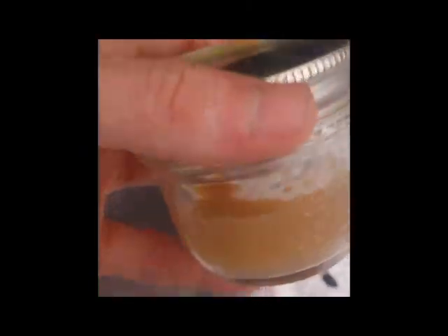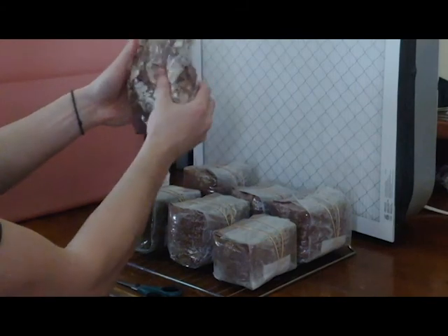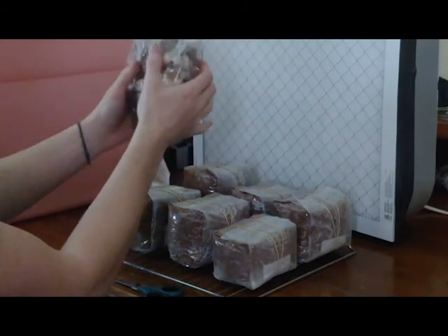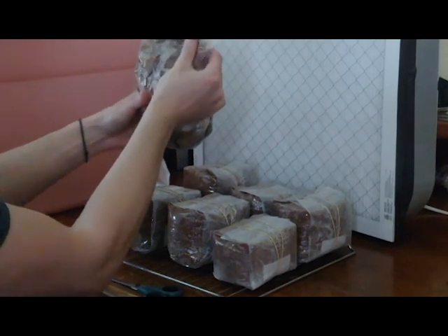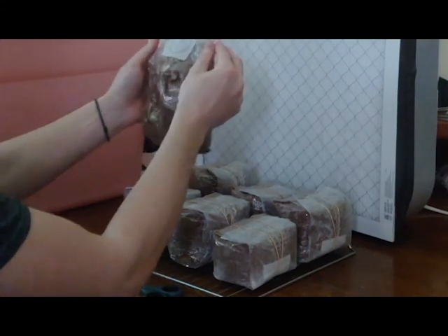Fast forwarding about two weeks later, I'm in my grow tent right now just going through looking for any contamination. Looking at the first few, it's all fine — there's no contamination — and then we have some contamination obviously. I set that one aside and will dispose of it in the green bin. This is actually my master slants. So obviously you're going to have some contamination no matter what; it just comes with practice. You just have to make sure you're doing the right sterilization practices.